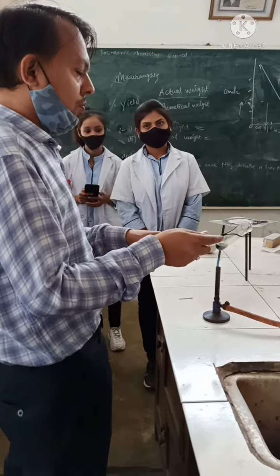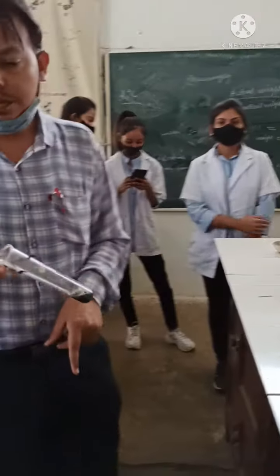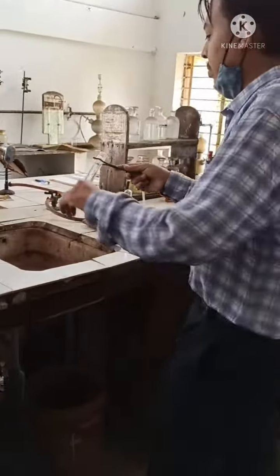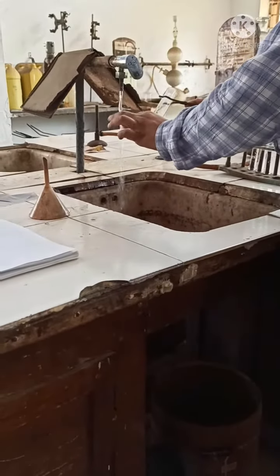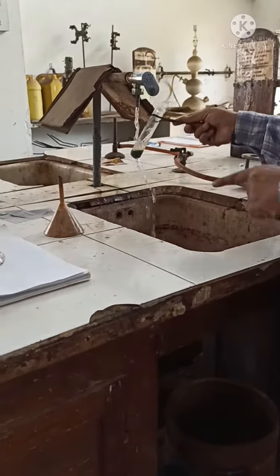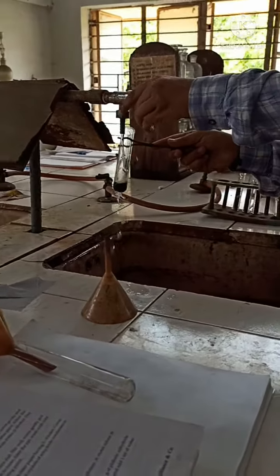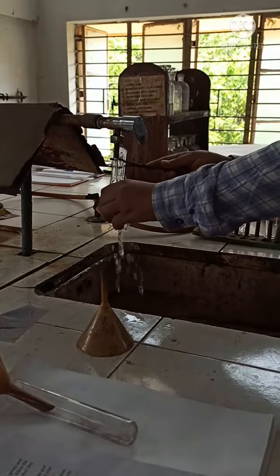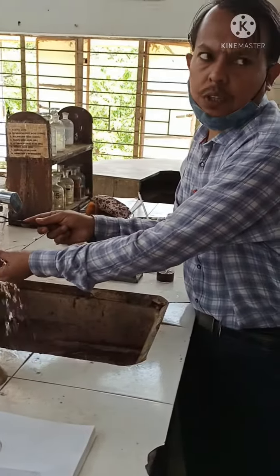It is boiling now. Okay? And then you have to cool it in tap water. So now, using this tap water, we are going to cool it — for about 30 seconds, you have to cool it.